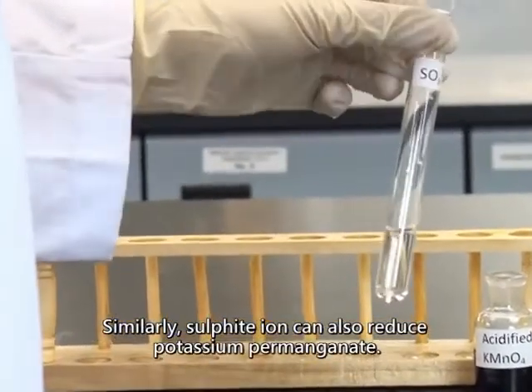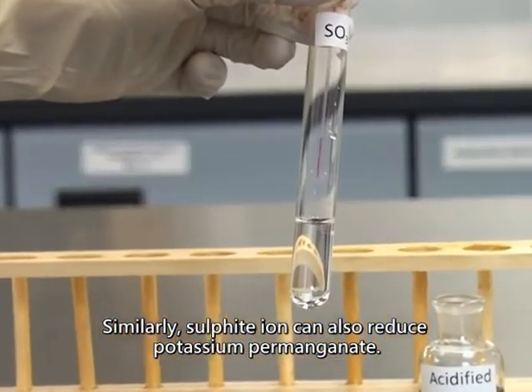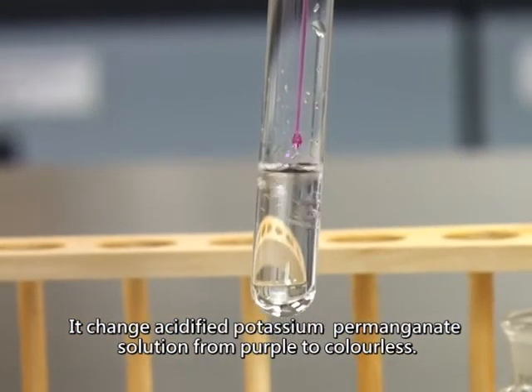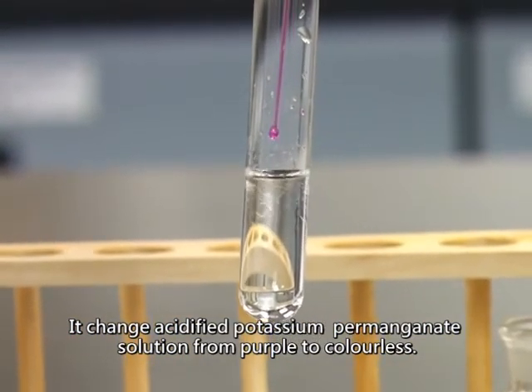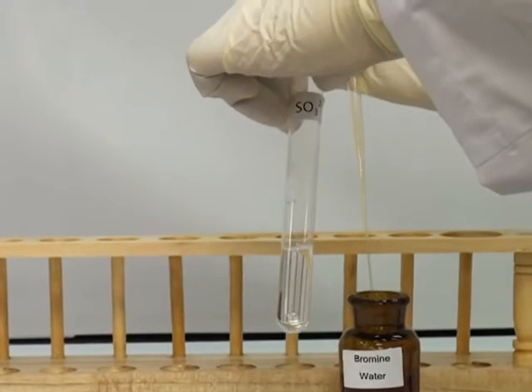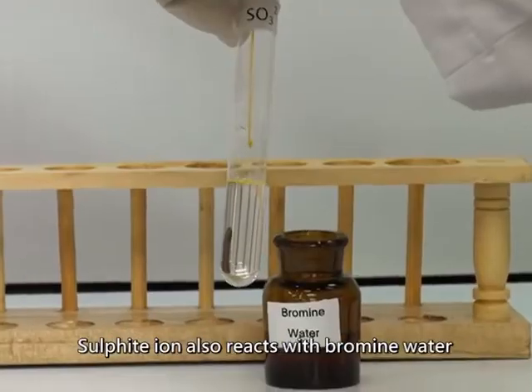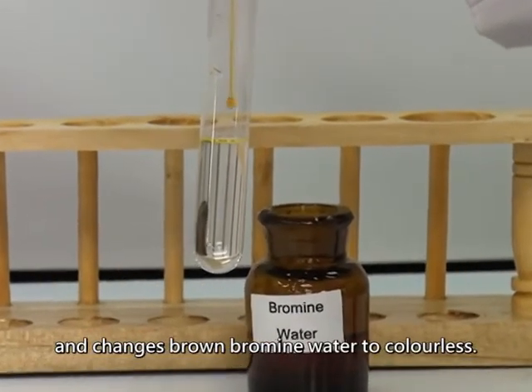Similarly, sulfite ion can also reduce potassium permanganate. It changes acidified potassium permanganate solution from purple to colorless. Sulfite ion also reacts with bromine water and changes brown bromine water to colorless.